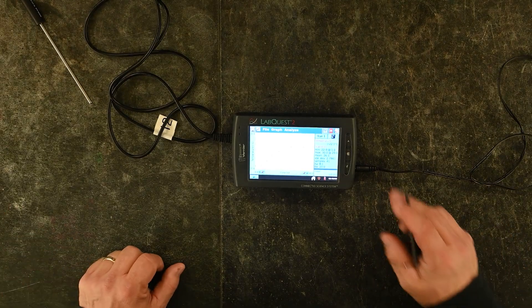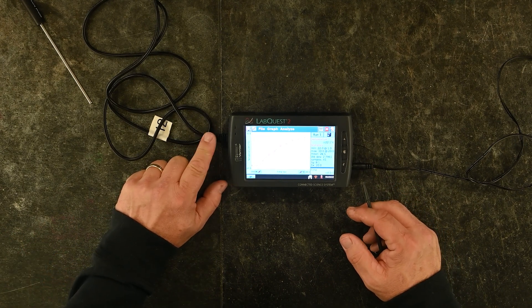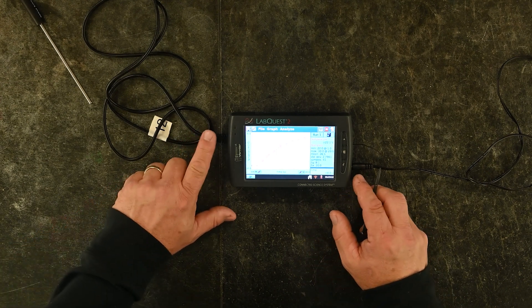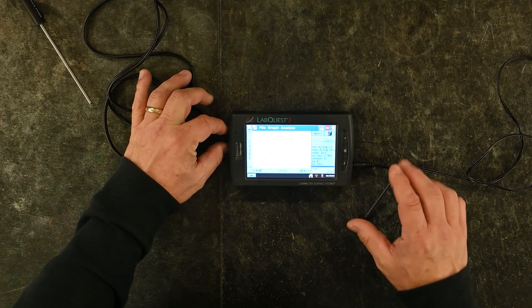The other sensors in the package are conductivity and pH. Both plug in the same way as the temperature probe, into the same analog port. Those all plug in there — the only one that's different is the SpectroVis Plus.